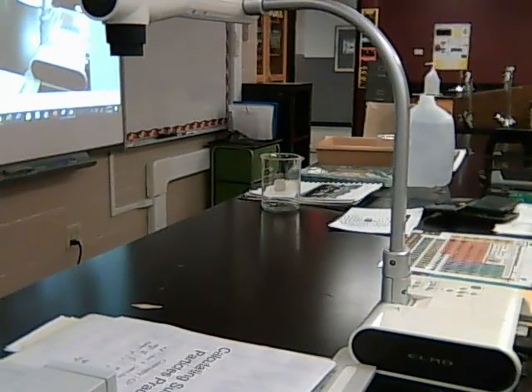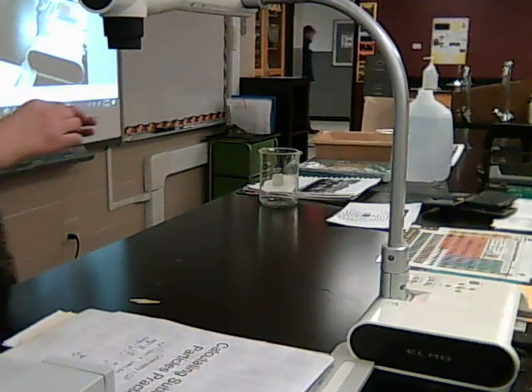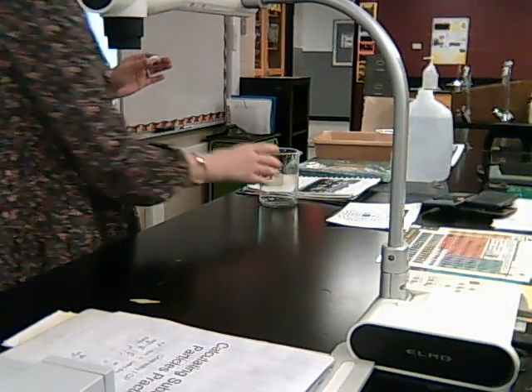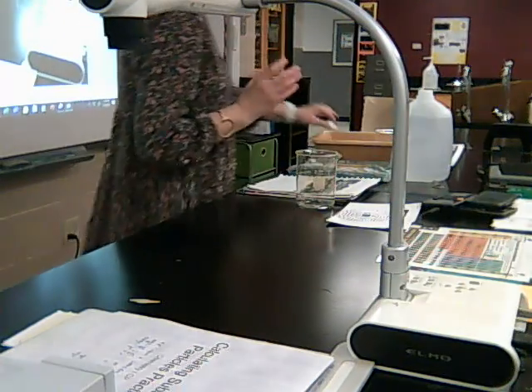Okay, so what I'm going to do now is turn my camera around so I can video what I'm doing for everybody. So everybody at home will be able to see what I'm doing too. All right, so you're going to continue completing the slides as I do the experiment.